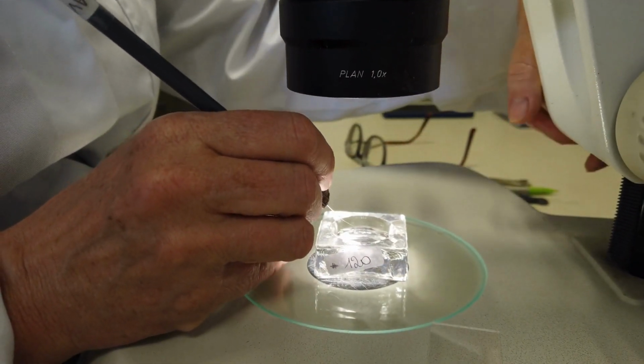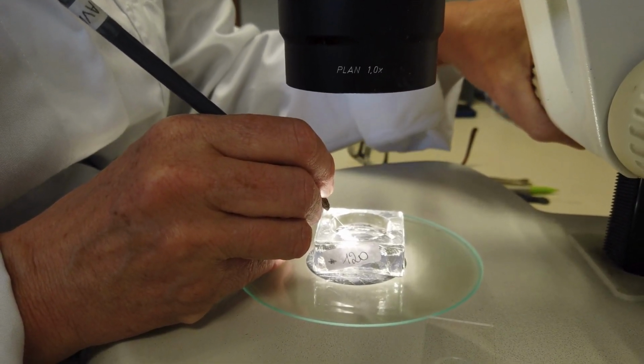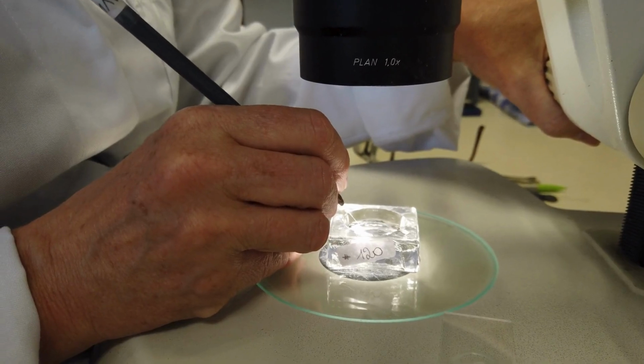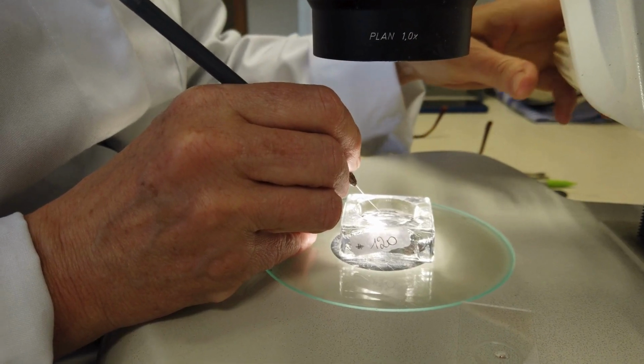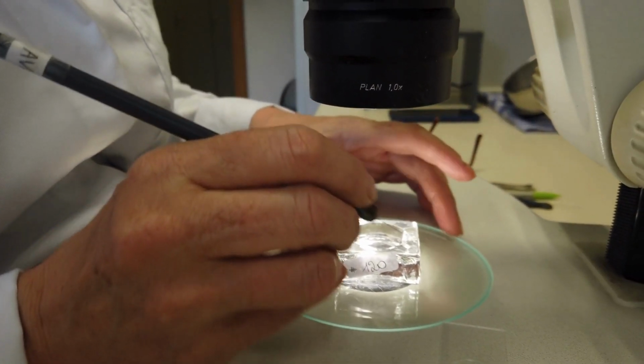Proper identification of nematodes requires ensuring that organisms are mounted on glass slides, which helps the preservation of the specimens and their identification to species level. Nematodes are picked and transferred to a glass embryo dish using a fine needle, aiming to collect at least 100 specimens per sample.